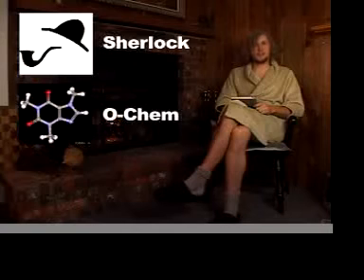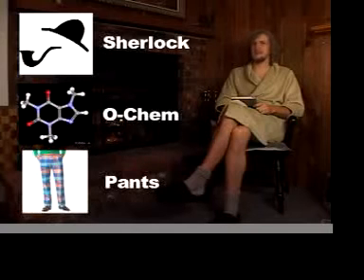Today we're going to learn about qualitative analysis, a process that scientists use to identify unknown chemical compounds. So please join me in this next riveting edition of the Sherlock Holmes Organic Chemistry Fancy Pants Theatre.